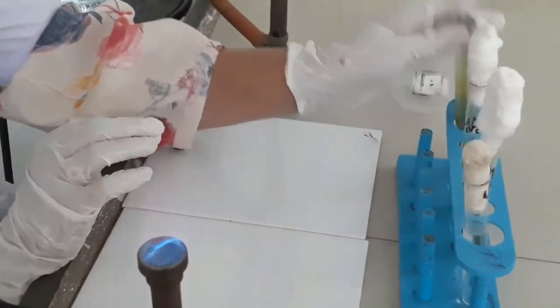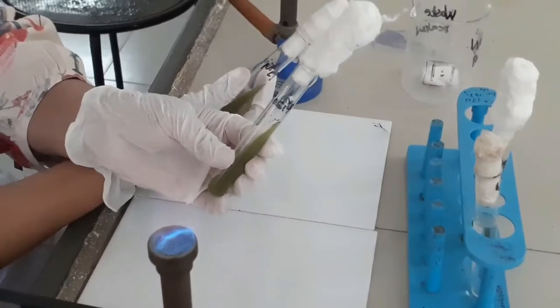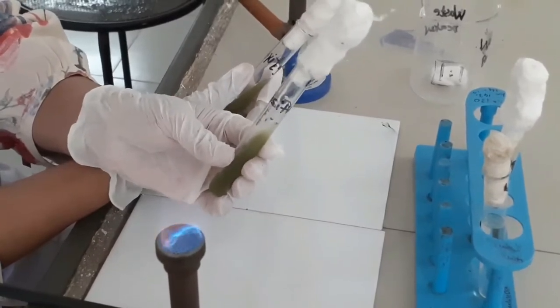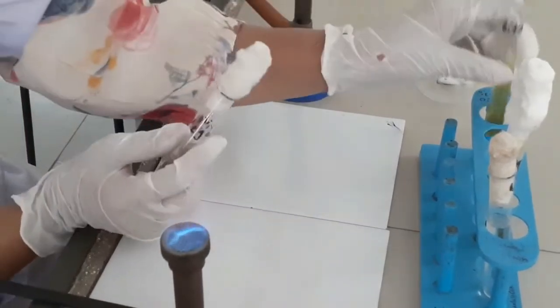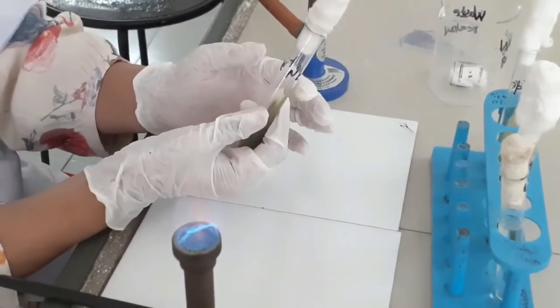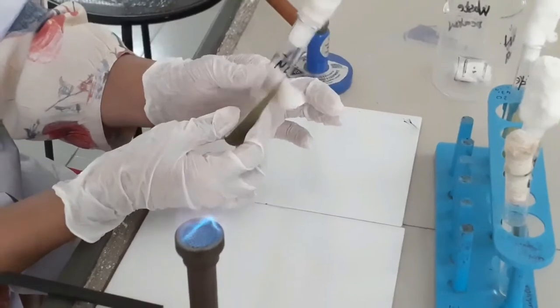Likewise we can have a positive control and a negative control. The positive control slant is to be inoculated with an organism like Klebsiella pneumoniae, which gives this test positive, meaning this type of organism is capable of utilizing sodium citrate as a carbon source. The negative control can be inoculated with organisms like E. coli. These organisms are not capable of utilizing sodium citrate, so they will give this test negative.